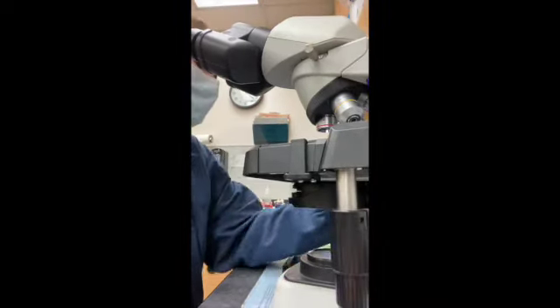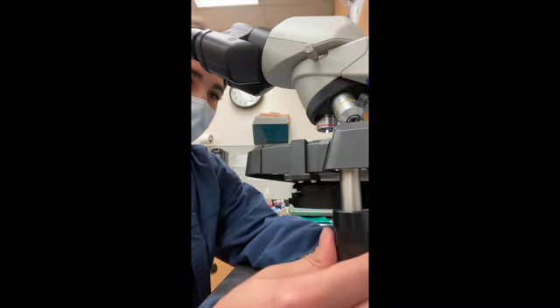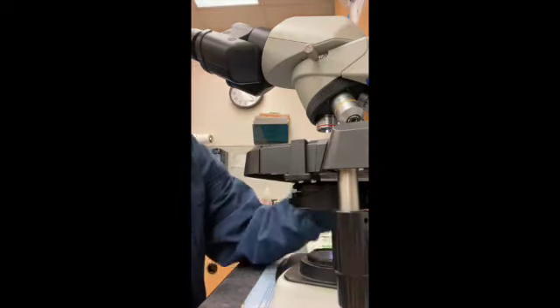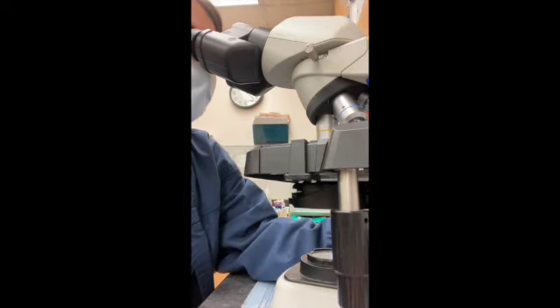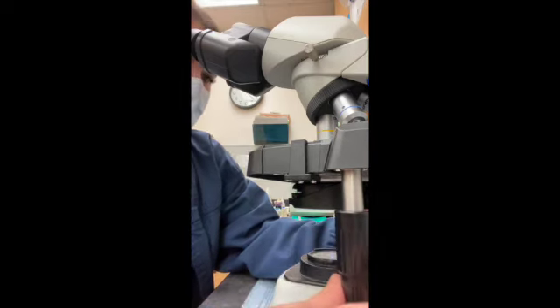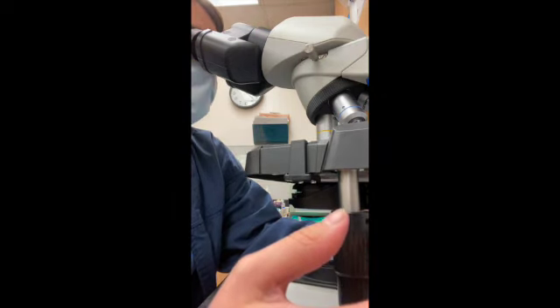Once we have our slide prepared, we'll put it on the microscope and get ourselves focused on the lowest objective, which is our 10x. Then slowly move up until you eventually get to oil. Just want to make sure you have it focused on all fields.